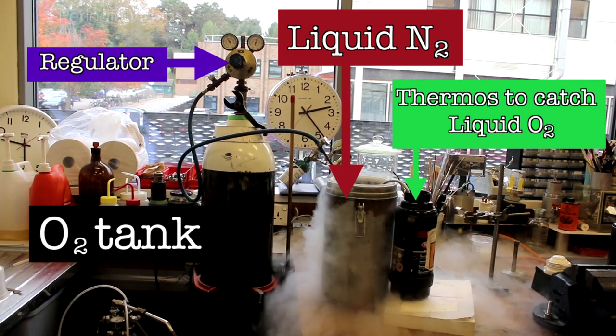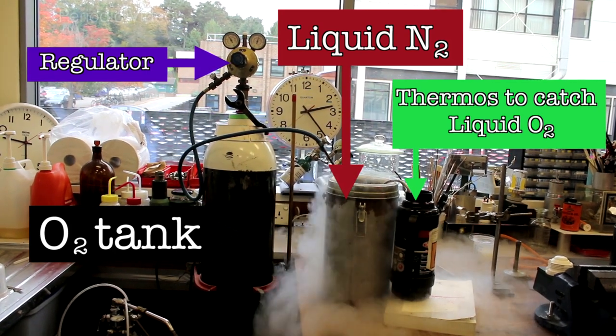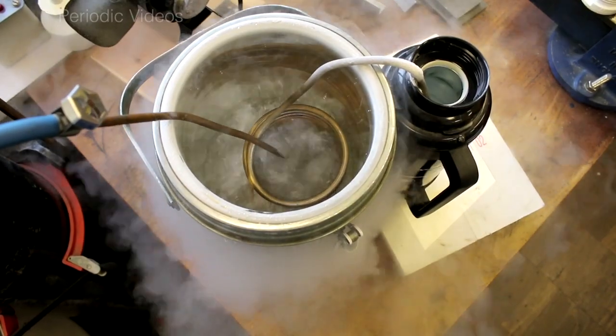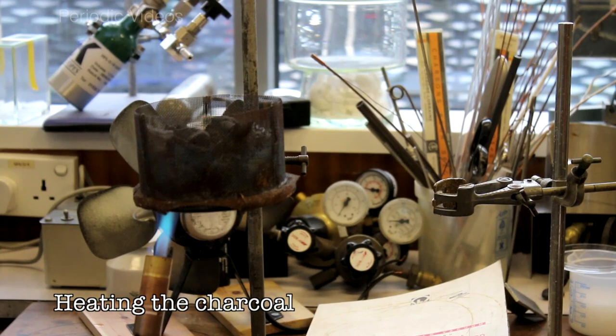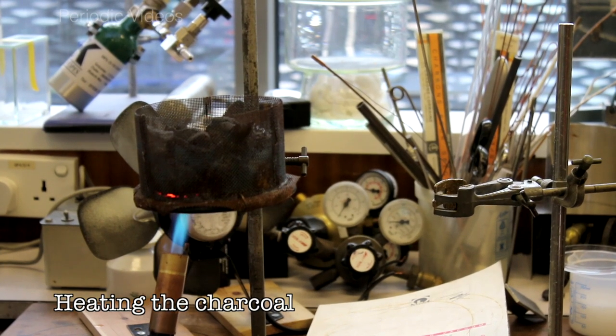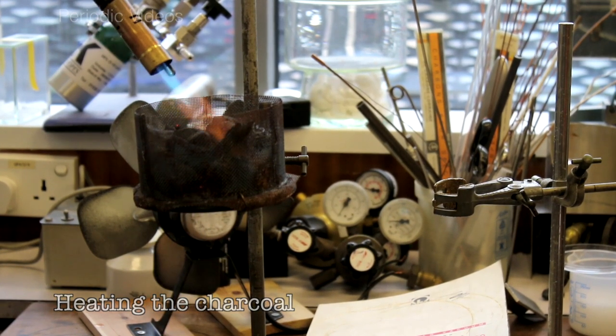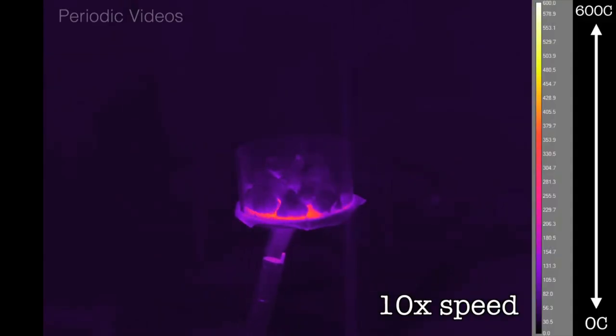We didn't have much oxygen, and because once it's in the bowl it will boil away quite quickly, it was important to get the hot charcoal ready first, because the charcoal will gently burn in air, so once it's hot, it will stay hot for quite a long time. So Neil heated the charcoal, really like lighting a barbecue.